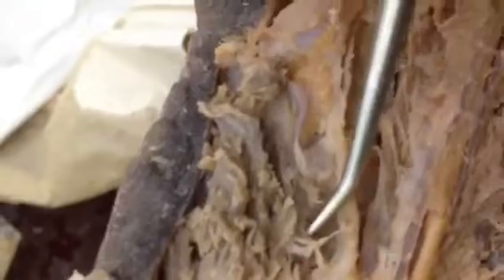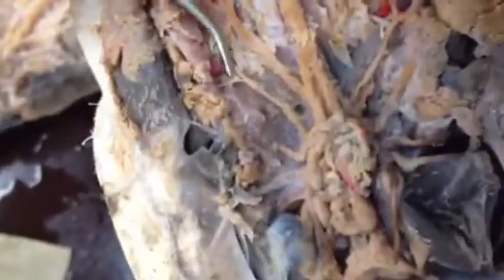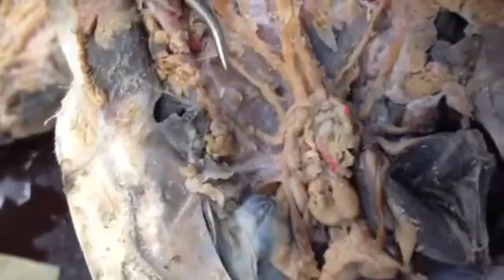You want to show it on mine? On yours? The bottom. That's what — where do you have it? I don't see it. Oh yeah. So — post, pre, pharyngeal. Okay. Away from the glossopharyngeal, there are three. Okay, don't even look for it — here. Okay.